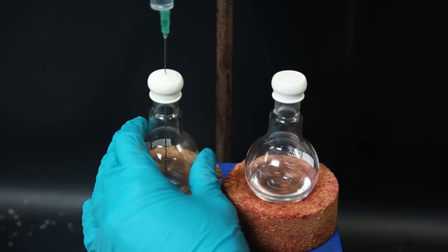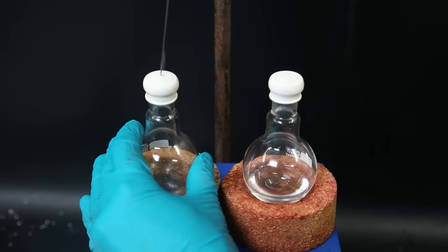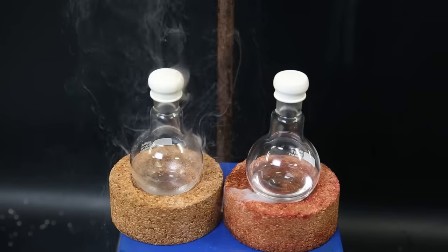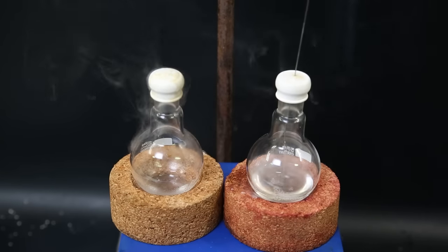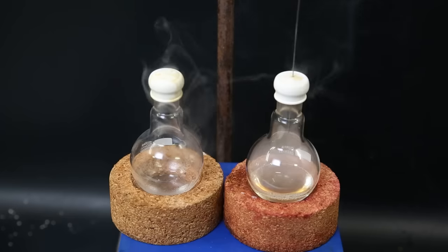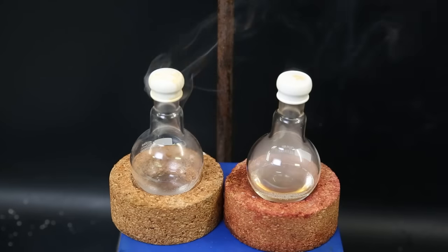So I take out 1.1 ml of the tin chloride with a needle and syringe and then inject it into the flask with the tetrabutyl tin. The reaction produces a little bit of heat and the mixture turns yellow, probably from some impurity.